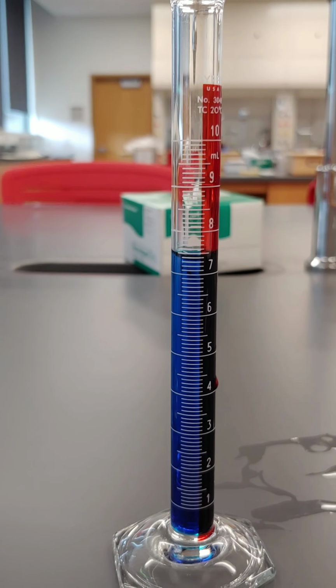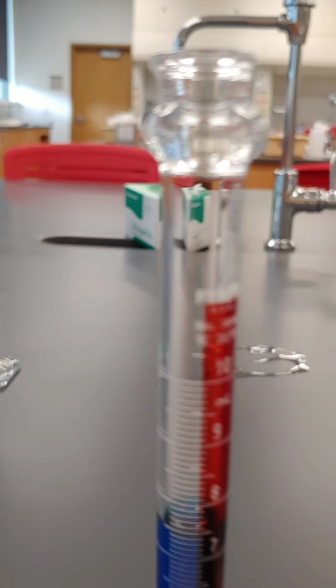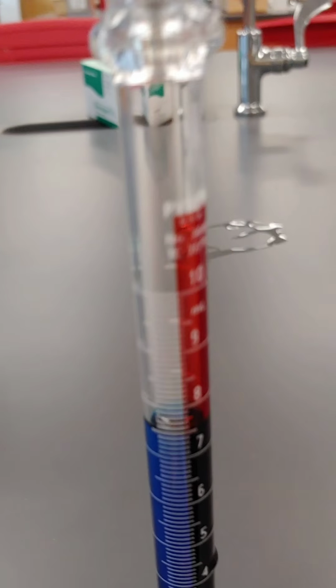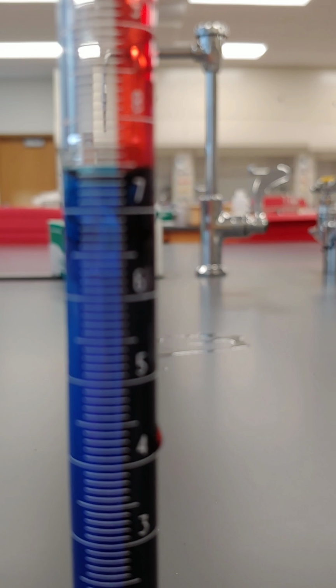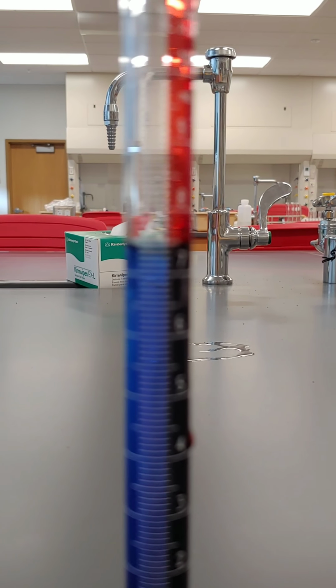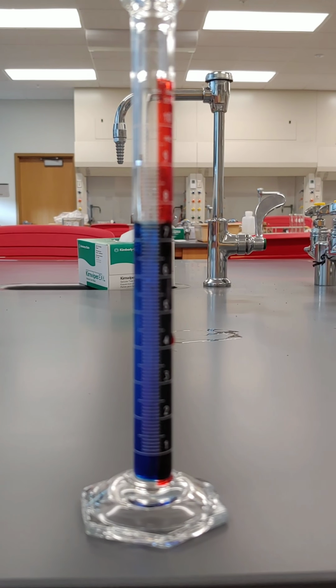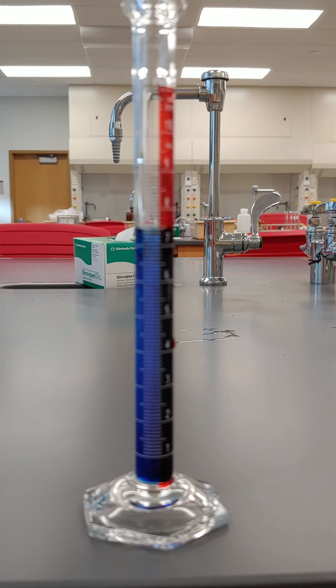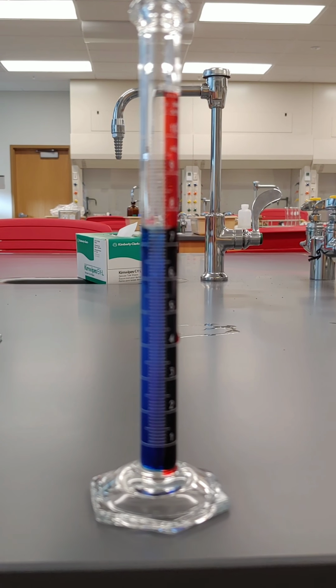What's important when we do liquids in containers is sometimes we can get a meniscus in a cylinder. And so a meniscus is when the water takes on kind of a U shape. If you look at the very top of the water there, you can see that the water is kind of U-shaped at the top. And so when we read the volume of that, we want to measure the volume at the bottom of the meniscus. And so we're going to see if we can figure out what that volume measurement might be.